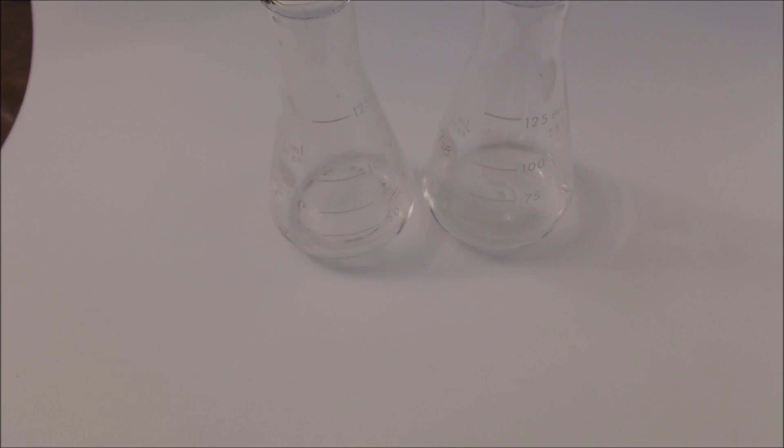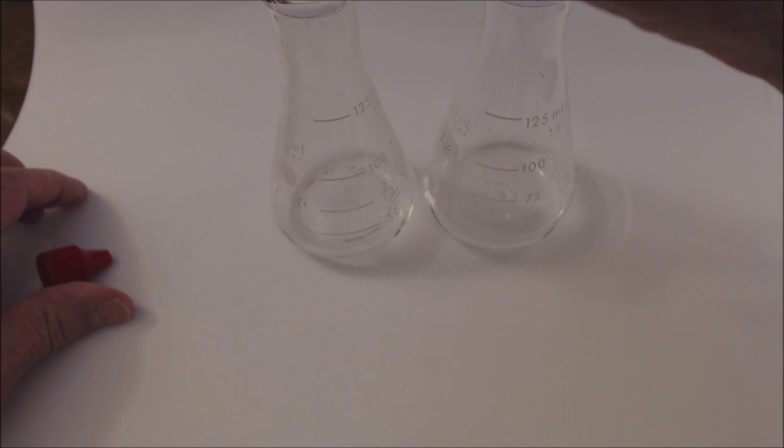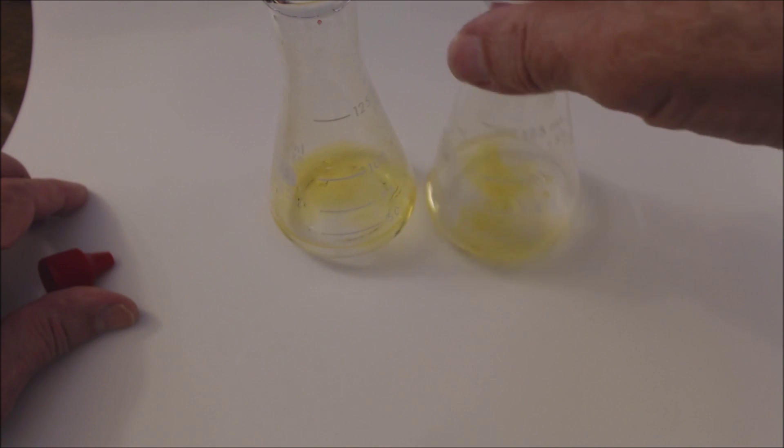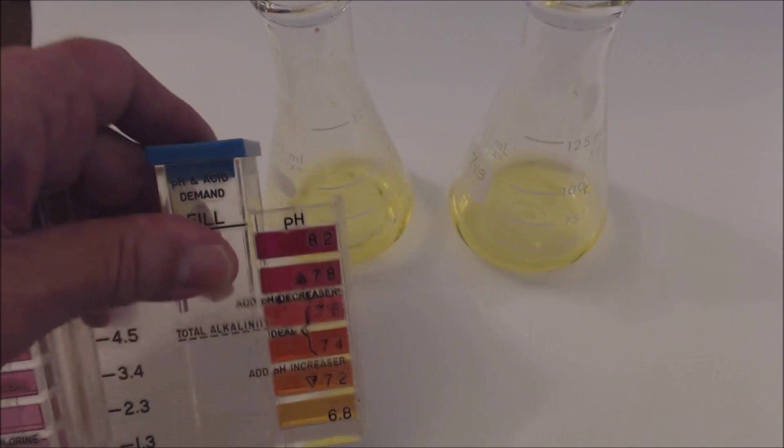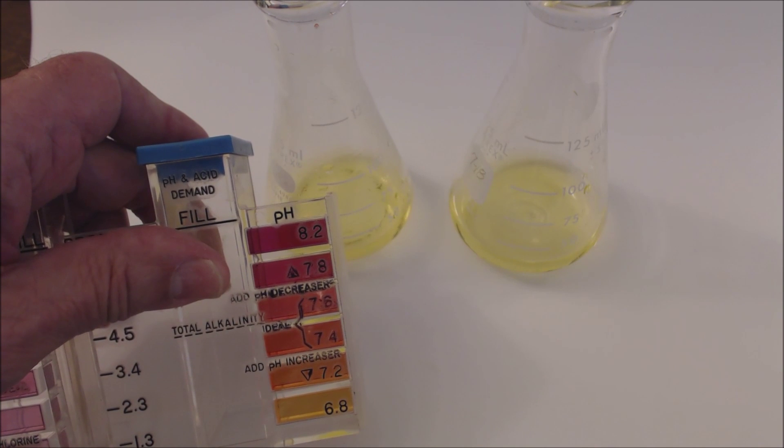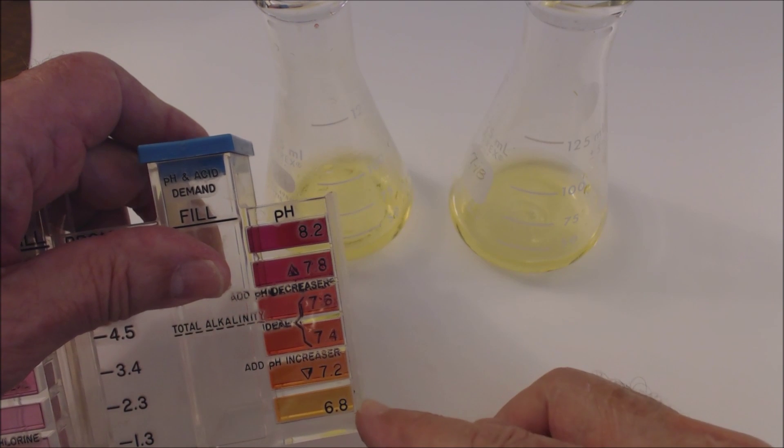I'm going to add about 20 drops of phenol red to each. You can see it has a yellow color, and this is consistent with an acidic solution.